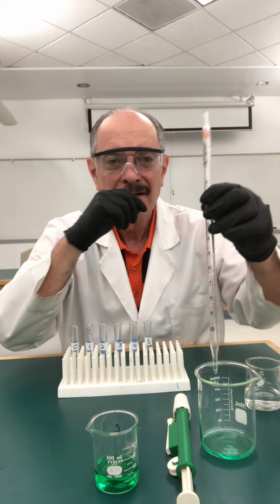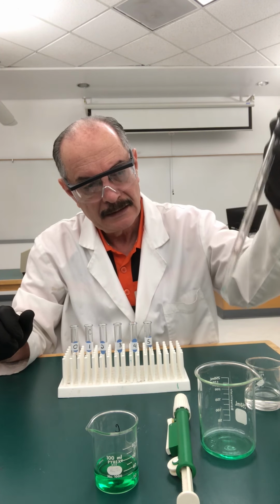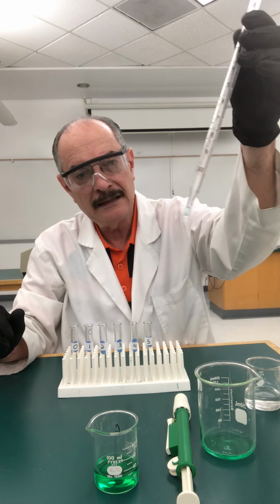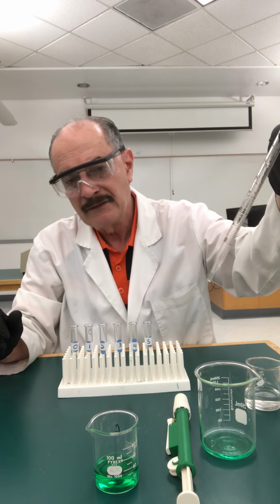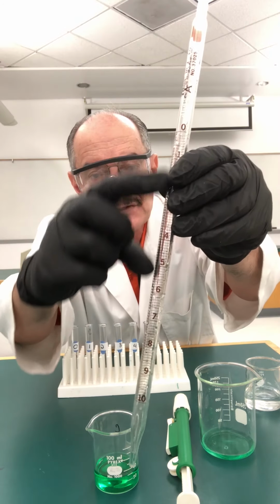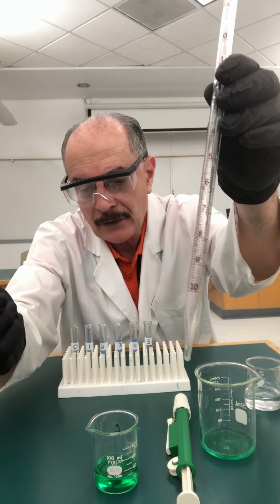By the way, don't blow on it on the top, okay? Don't blow on top. Just let it drip. That last drop in there, you touch it to the side of the beaker to let it fall down. And that little droplet at the bottom, if you are interested, it's typically calibrated, but we're not going to use that because our pipette goes from 0 here to 10 here at this line. So we never want to go below that anyway, all right?